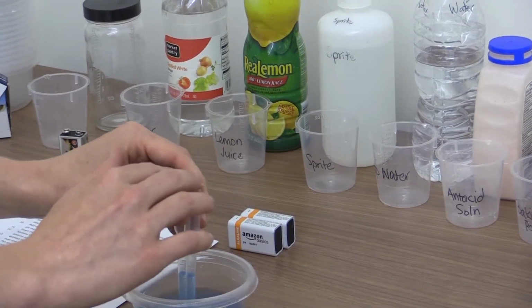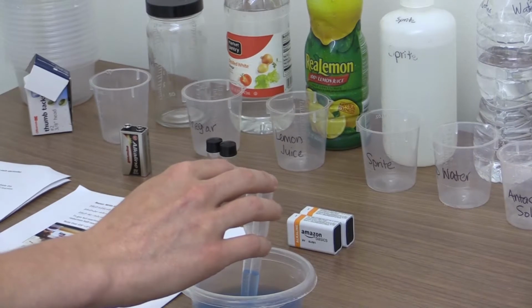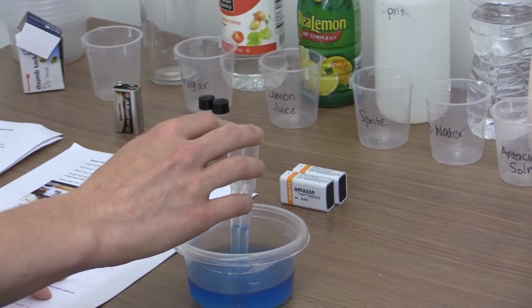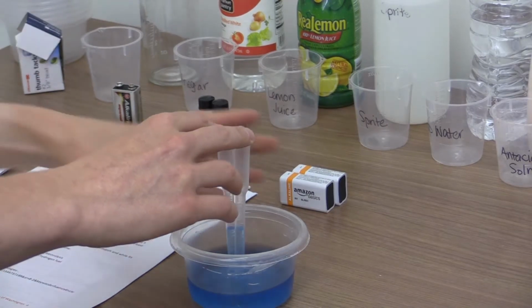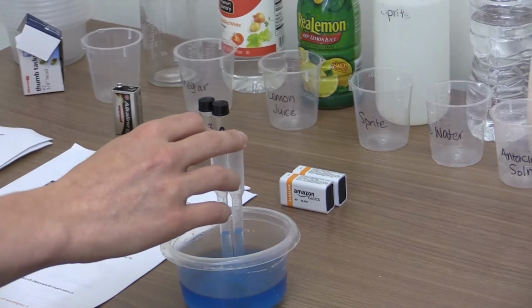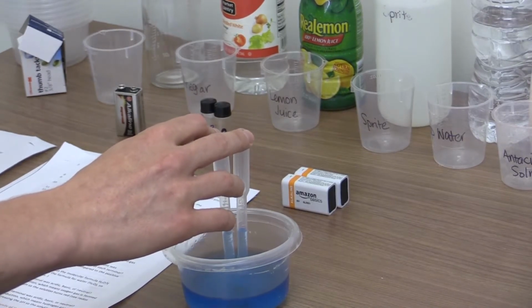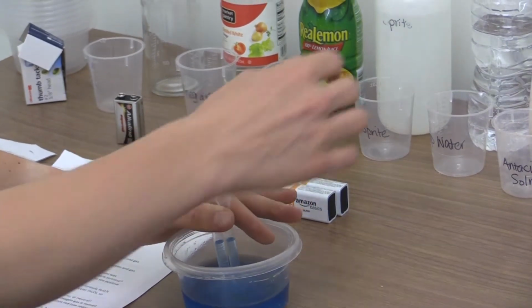Because at one electrode you're going to be producing oxygen, and at the other electrode you're going to be producing hydrogen gas, you'll be able to notice a difference in the gas accumulation at the electrodes. And so that can tell you which one is your cathode and which one is your anode in this experiment.